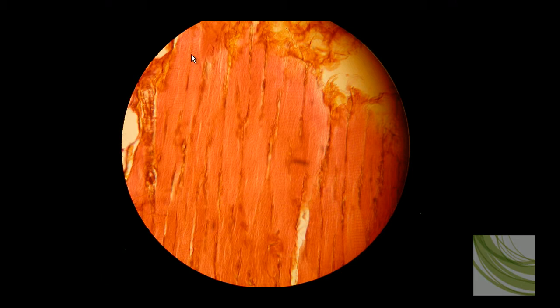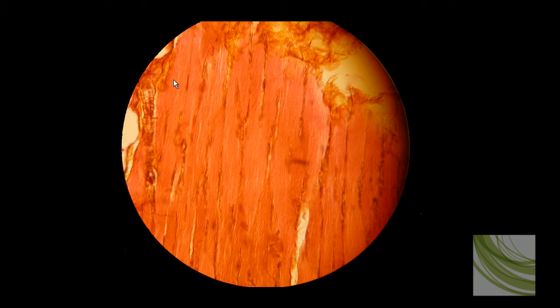Here is the same slide using the 40X objective and at this magnification you can see some striations going along here and interspersed throughout. There's a good spot of striations. To get really good results here, you're going to use your fine focus to go up and down and you will bring different areas of striation into focus.